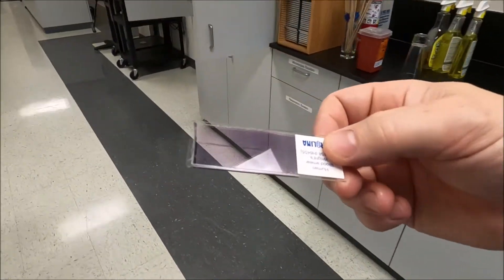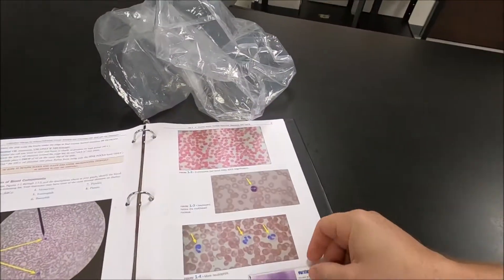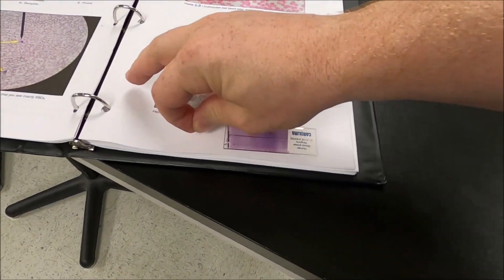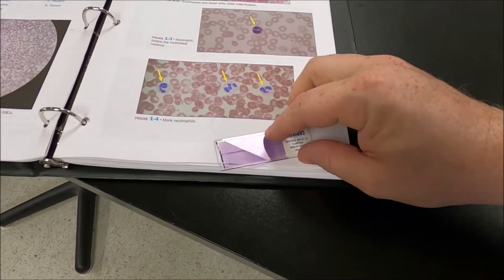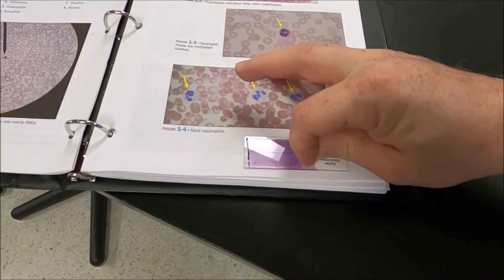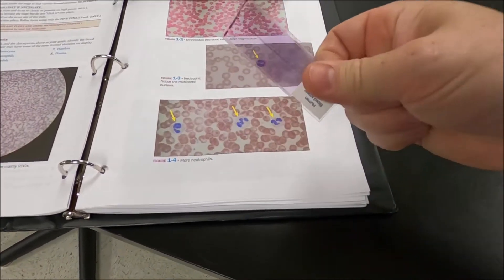What is done on a blood smear is you take this thing, set the slide down, put a drop of blood here, take a cover slip and rake it across the slide — that makes a blood smear. It's been covered over with a big cover slip at this stage. To make them, you put a drop on one side, put a cover slip on it and drag it across. That's why it has this strange little line on the side. This is a good blood smear.